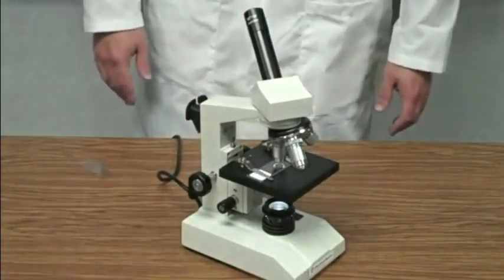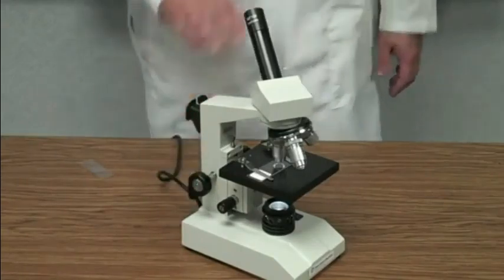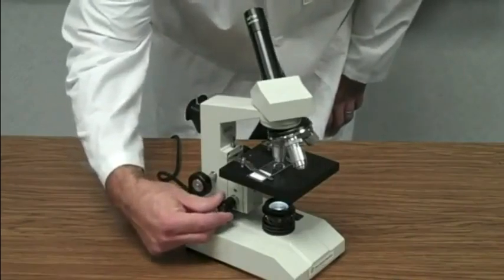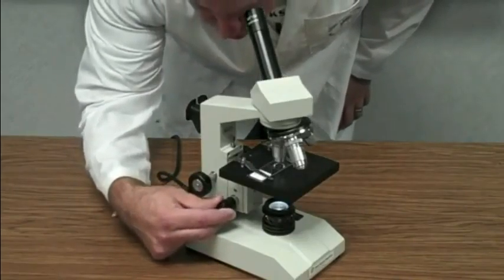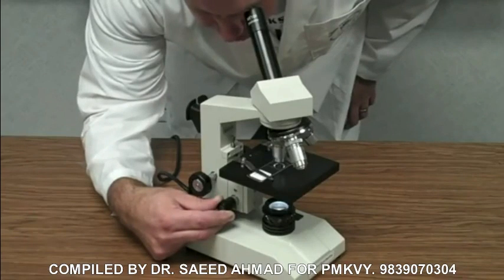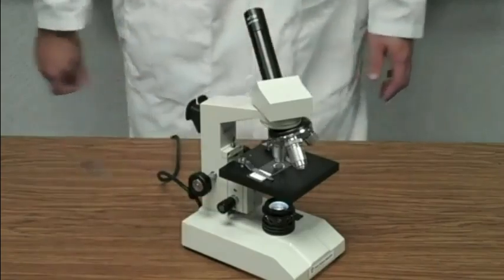Now, if I've done my job correctly, I should not need to touch the coarse adjustment knob again. I should be done with the coarse adjustment knob. I should be able to simply just use my fine adjustment knob to do a little bit of focusing, and I see my image much larger, much clearer through the eyepiece.